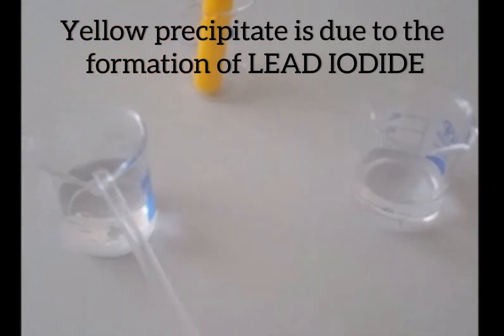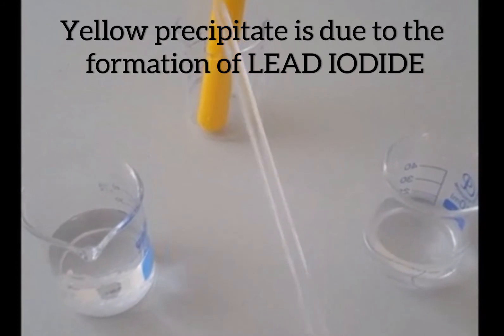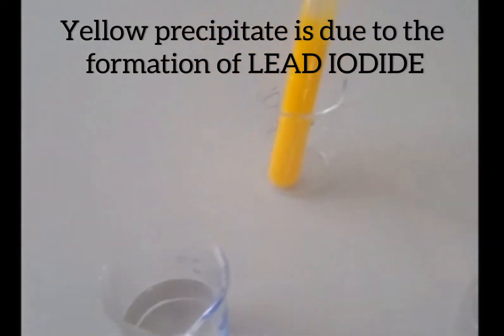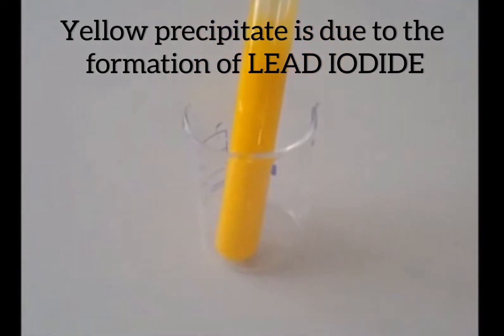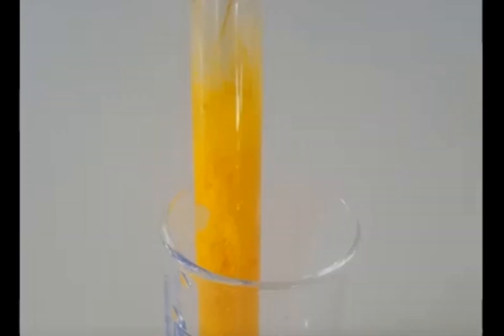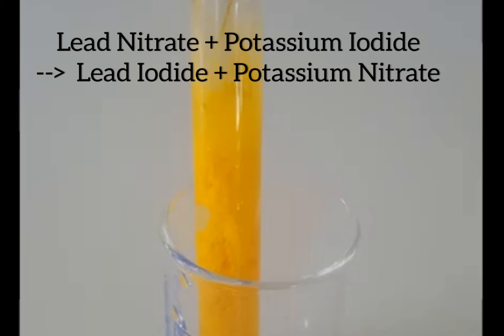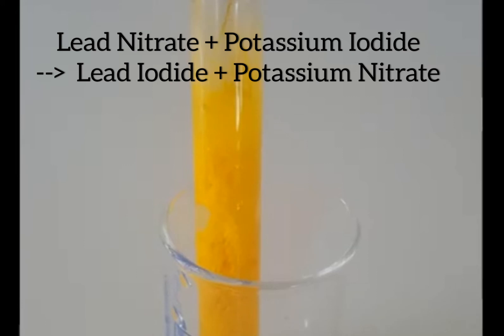When lead nitrate and potassium iodide react, lead iodide is formed as a yellow precipitate. Lead iodide is insoluble in water, which is why it forms a precipitate. The second product is potassium nitrate. Potassium nitrate is soluble in water, so it is formed as an aqueous solution and cannot be seen as a precipitate.